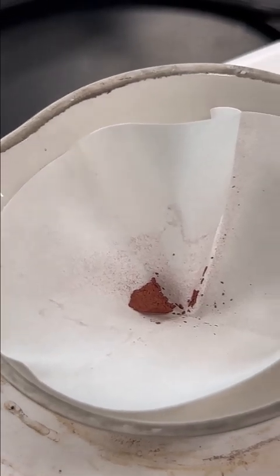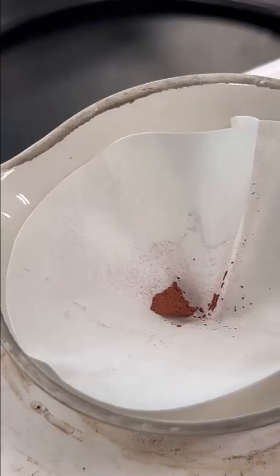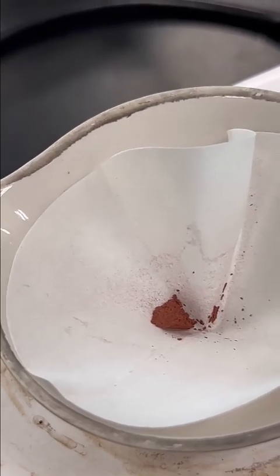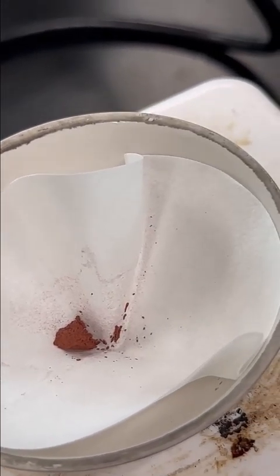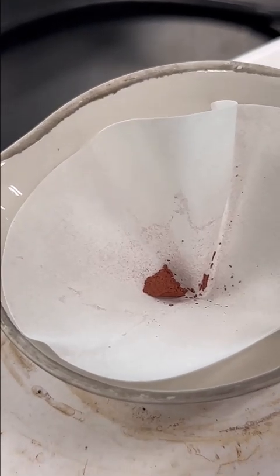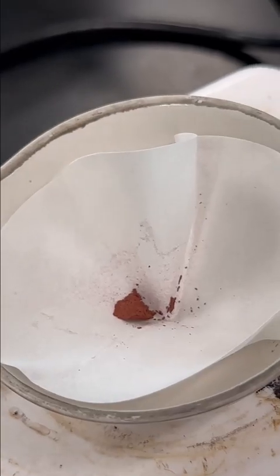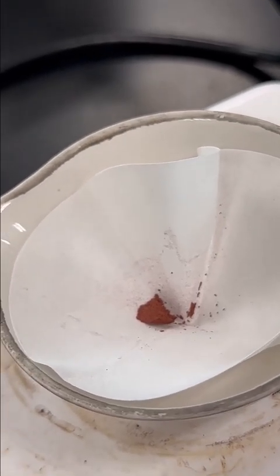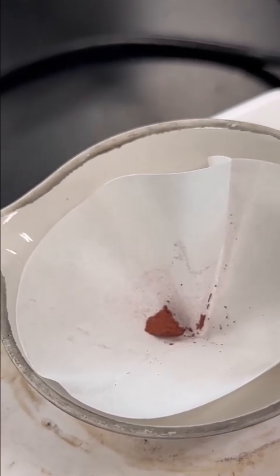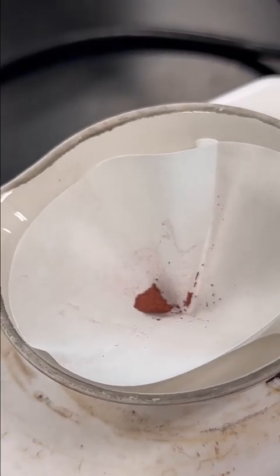I want to watch it because I want to stop this as it dries and doesn't get too dry, right? If I heat it too much, I could reform that copper oxide, which was black in color, and that weighs a lot more when it takes in that oxygen atom. So you just want the copper. This is elemental copper that we've recovered back, and it's called spongy red copper.